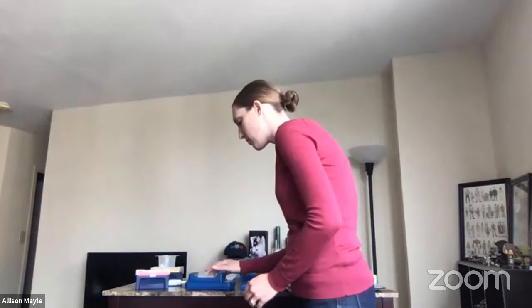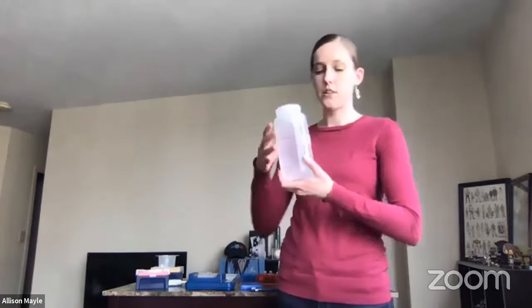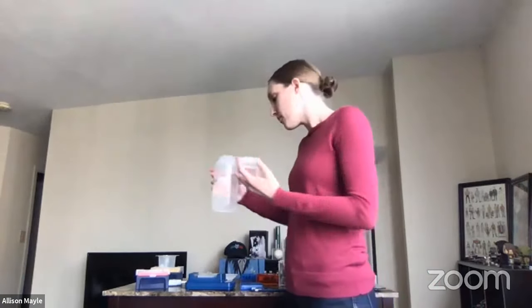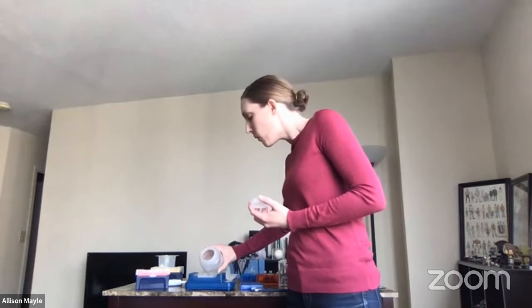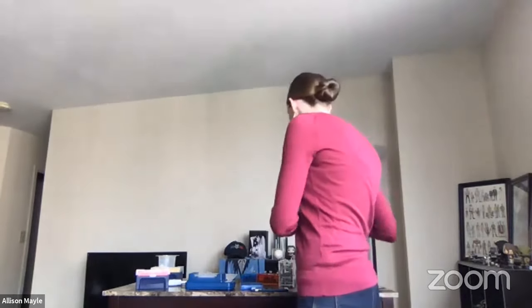The DNA would run from top to bottom, away from the wells. Now, with just this gel surrounded by air, nothing is going to happen if we turn on the electric current. So I have some TBE buffer — that stands for Tris-Borate-EDTA. It's mostly water with some buffer in it. I'm just going to pour that over my gel, and that's going to conduct the electricity so the current will actually run through the gel and push the DNA down into the agarose.